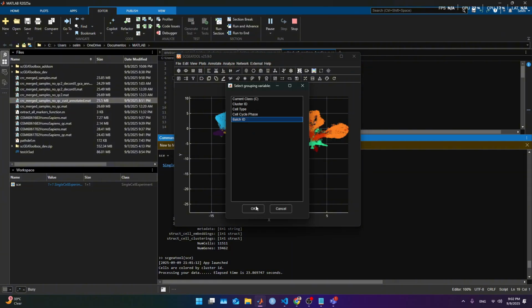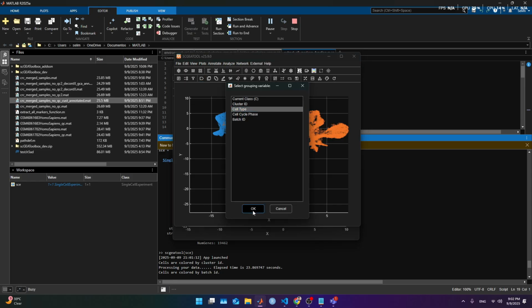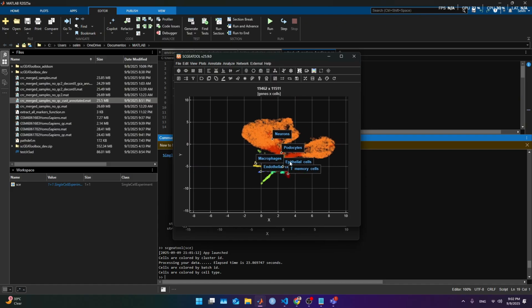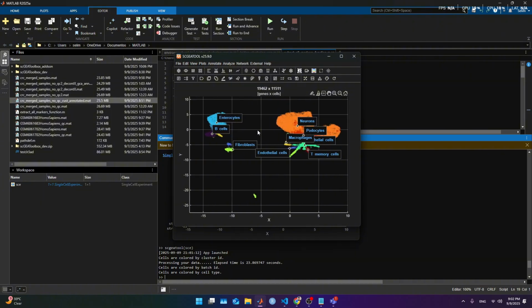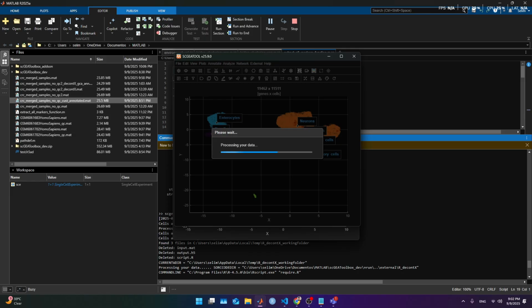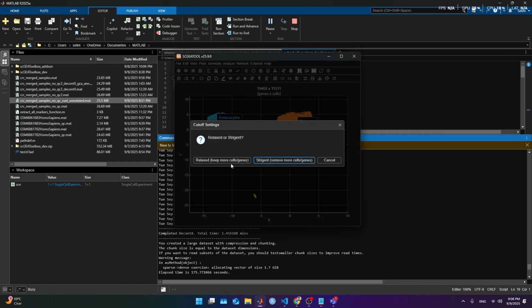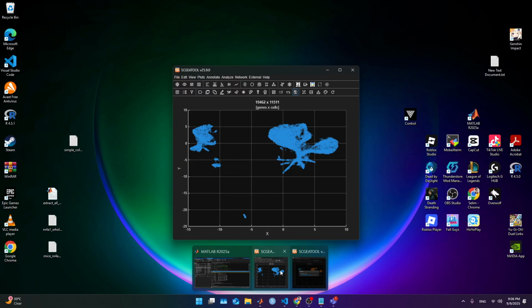If we look at the sample, batch ID, we see the blue separated from the orange. It is what it is. So we come back to cell types. And now we are gonna try to run decontamination again, and with that we should see a better separation within all these populations. That's part of the decontamination, especially now that we kept lower quality cells. So we're gonna run the detect ambient RNA, continue, use that, yes, and come back when finished. Alright, it finished, and then we hit ingest to accept the decontamination, and we are gonna do QC filter again, but as much as we did relaxed, we stick to relaxed. Otherwise we are gonna lose a lot of cells.